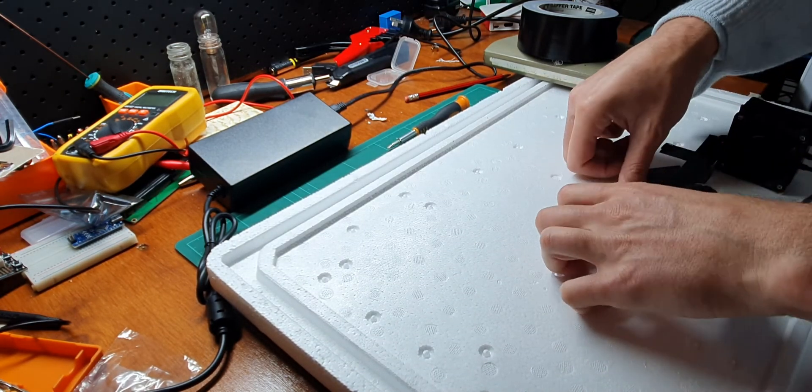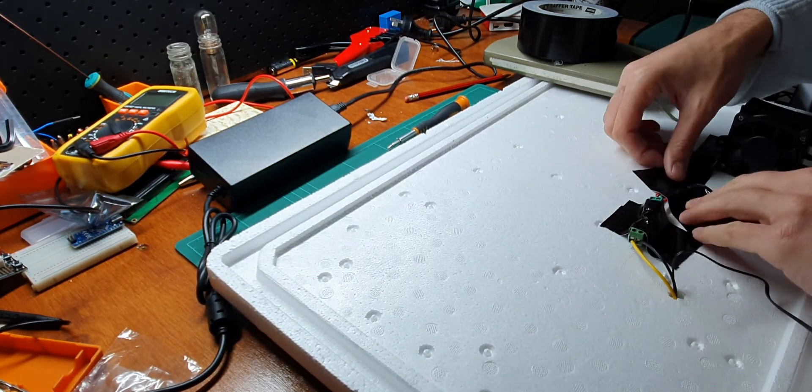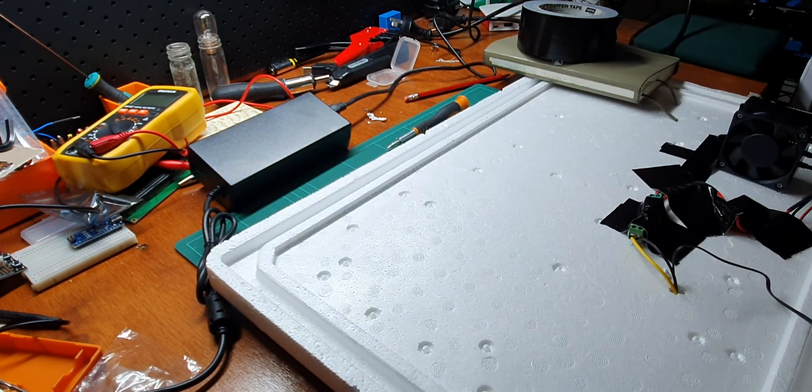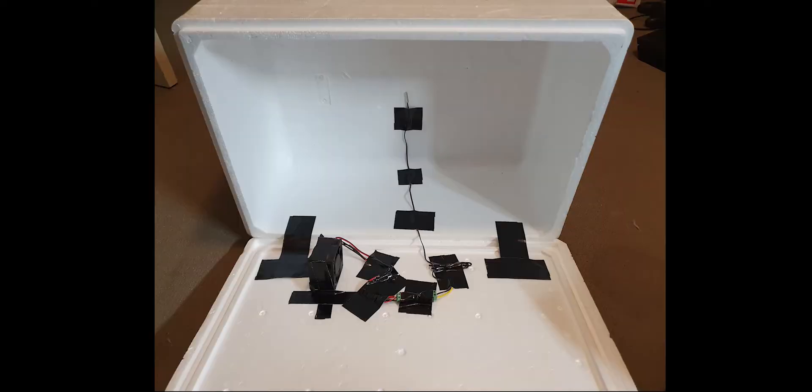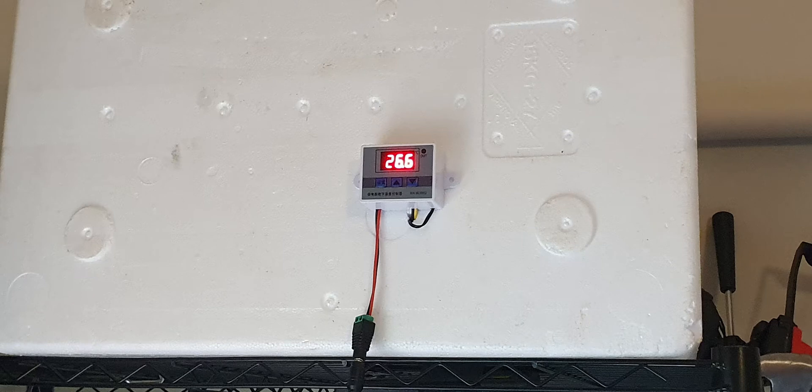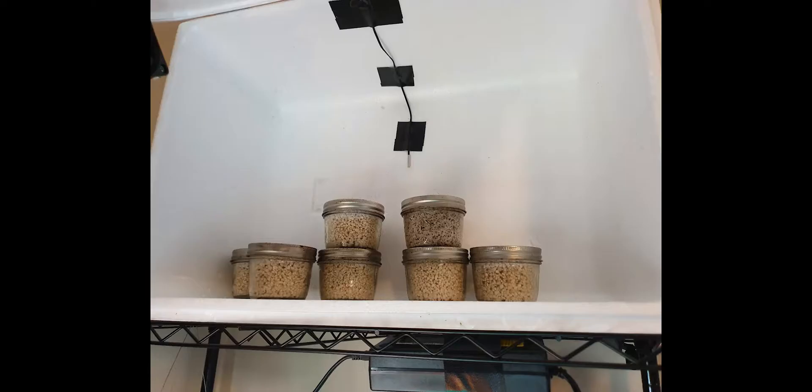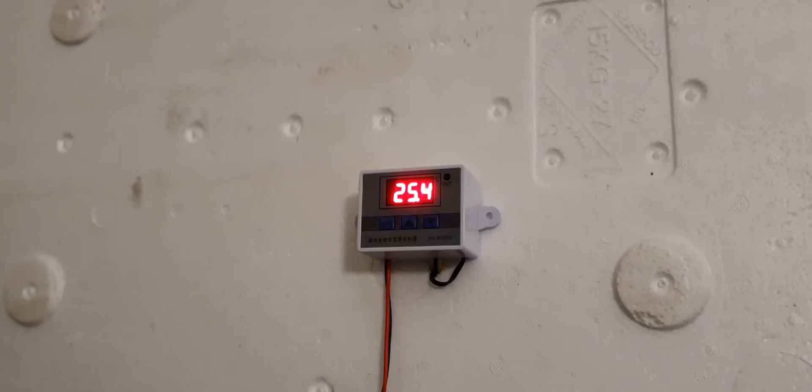So that's basically it. It's a pretty quick build - took me about maybe 10 minutes to put it all together. I used plenty of tape. I've got the heat sensor sitting in the middle of the incubator so it's kind of in a nice spot, not right close to the heater, not too close to the top where the heat's going to go, but towards the middle which I think is a good spot.